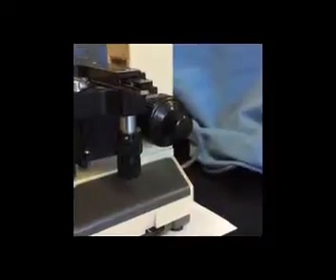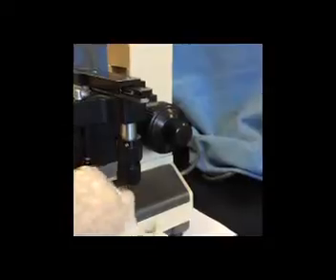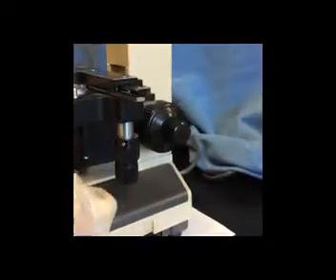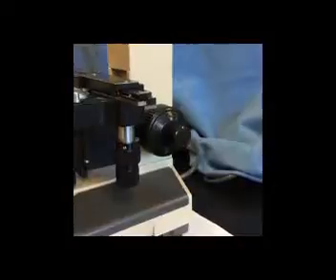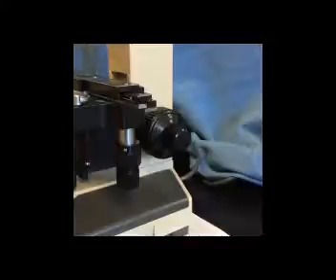And if the microscope has been put away in the cabinet properly, the rheostat should be on the lowest setting, 1 here. When we start focusing on our microbe using the scanning lens, I'm going to suggest that we start at a moderate level of light, say setting 4 or 5, and then as we increase magnification, as we move to low power, high dry power, and ultimately to oil immersion lens, we will increase the light intensity until when we're working with the oil immersion lens, we'll be working on the highest setting, say 9 or 10.